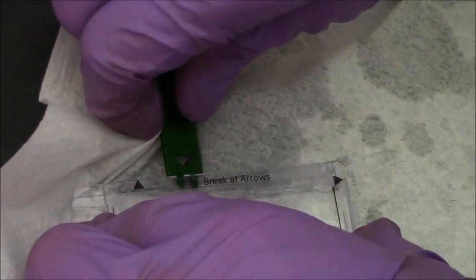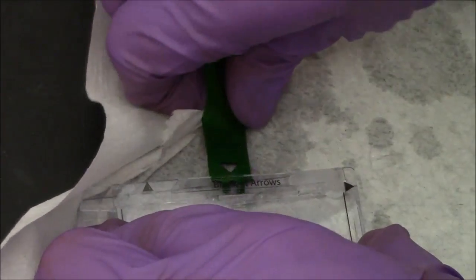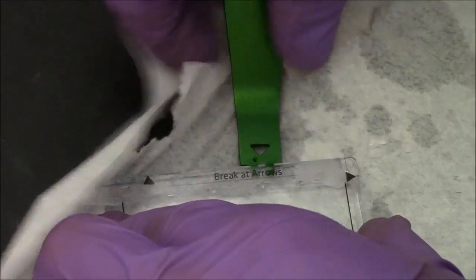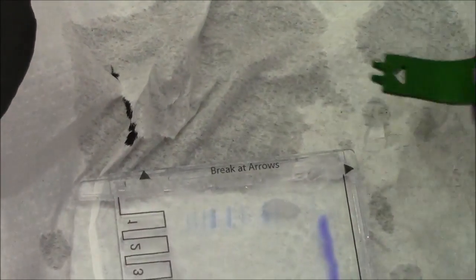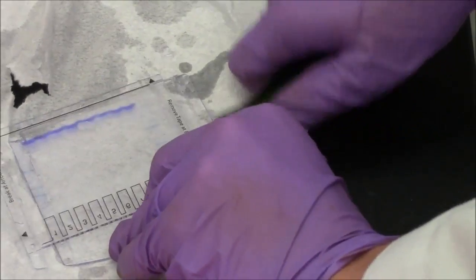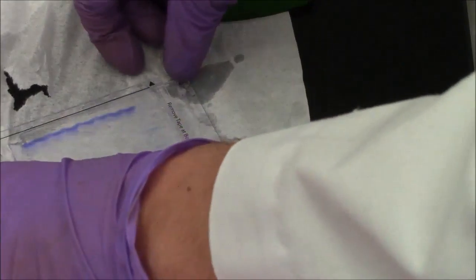Often after you've cracked the four triangles, you still have to go around the edge of the gel cassette, trying to loosen it up, and eventually you'll be able to crack the two plates away from each other.